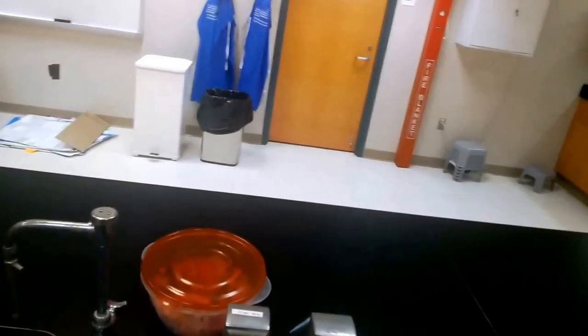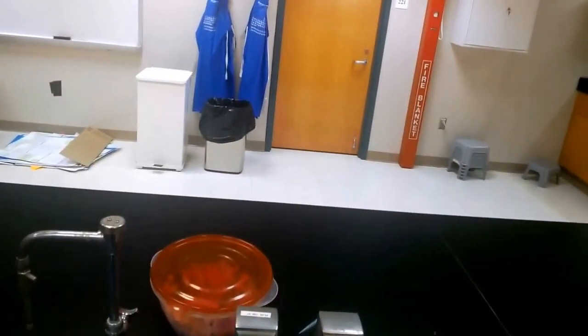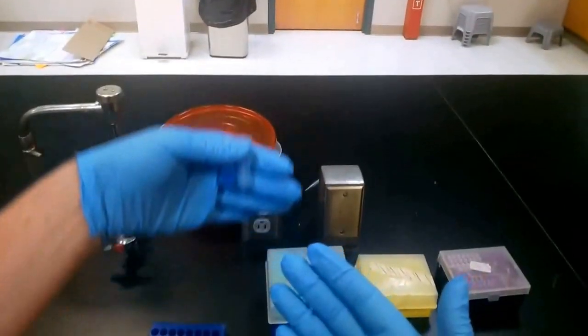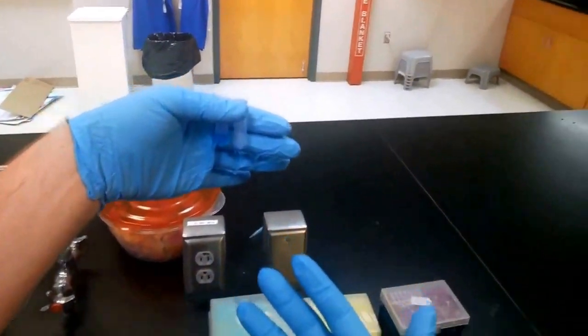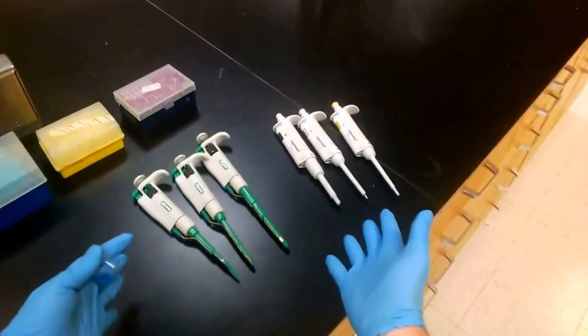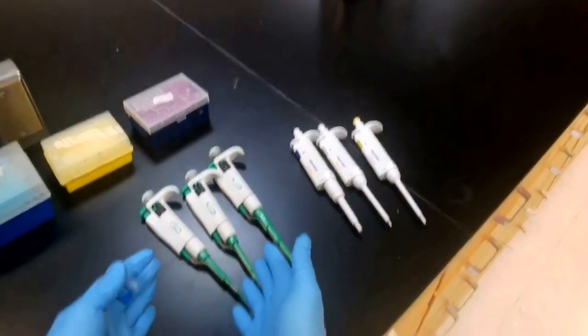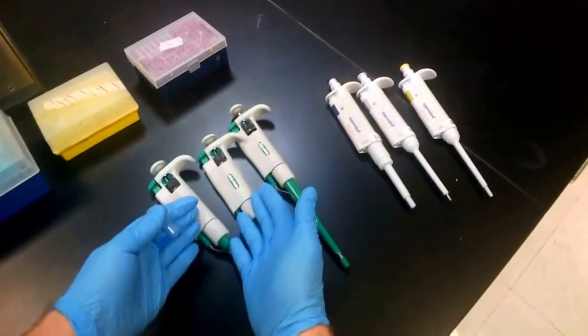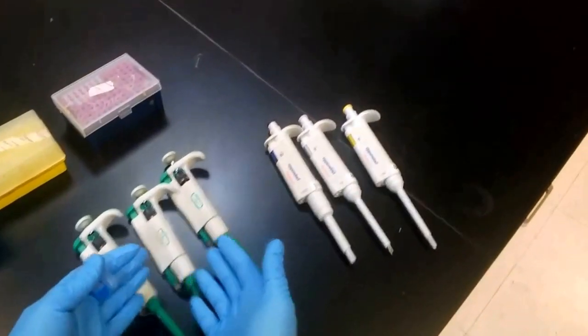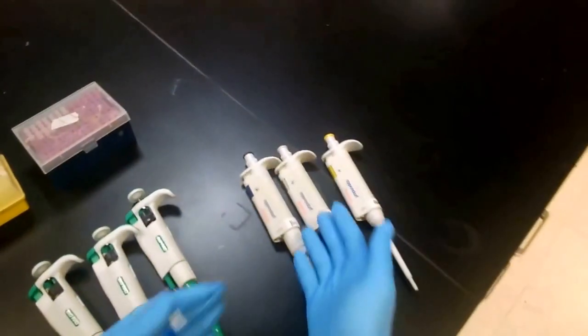Now in order to move quantities of liquid between test tubes much more precisely, we'll need to use micropipettes. I've got micropipettes from a couple of different companies, from Bio-Rad, which makes them for education and research, and from Eppendorf.